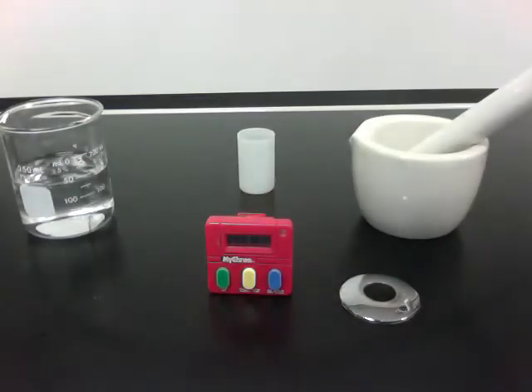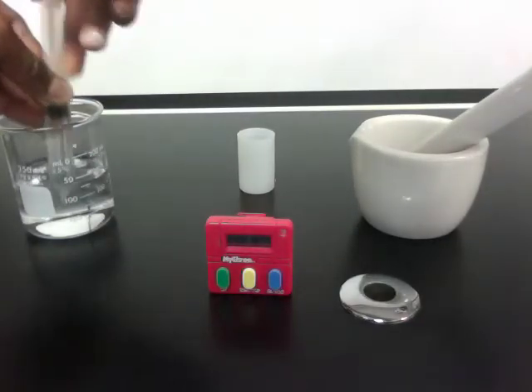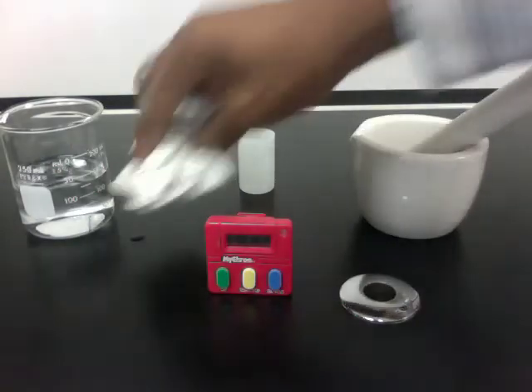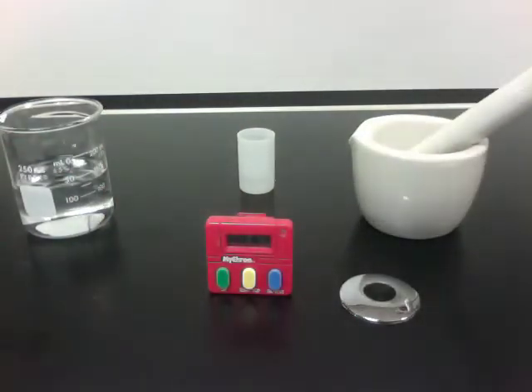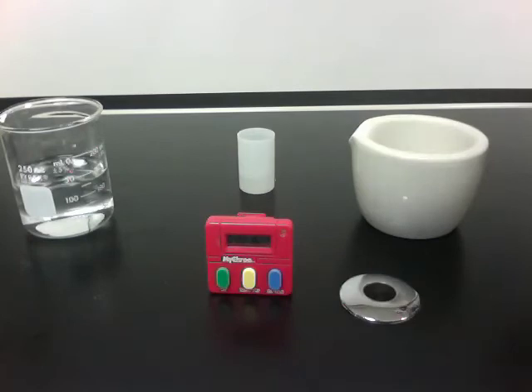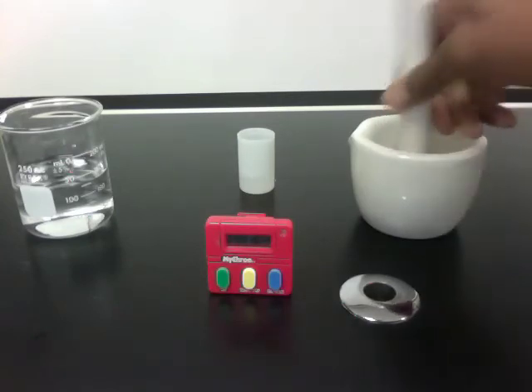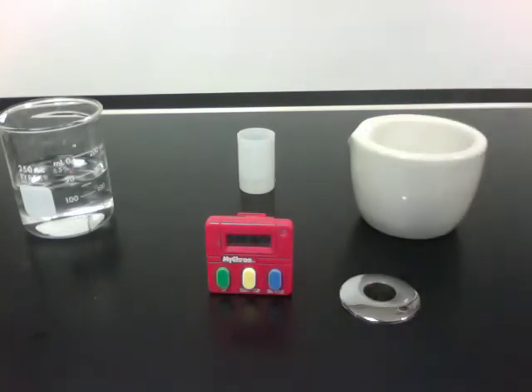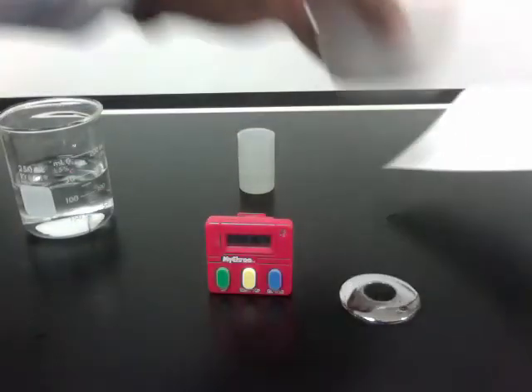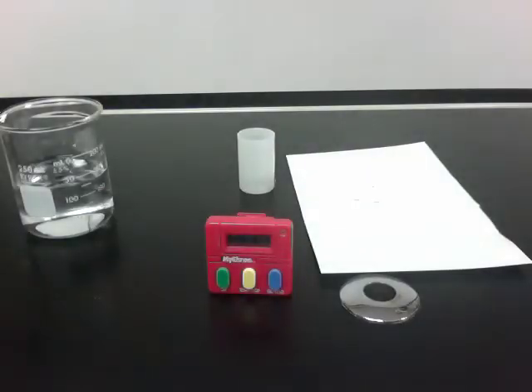Here's our film canister again. We'll put in 10 milliliters of water. This time we're going to take the second tablet and change the surface area by breaking it up into a few small pieces, using the mortar and pestle. We'll pour it out on this sheet of paper. So we have increased the surface area of the tablet by crushing it up.